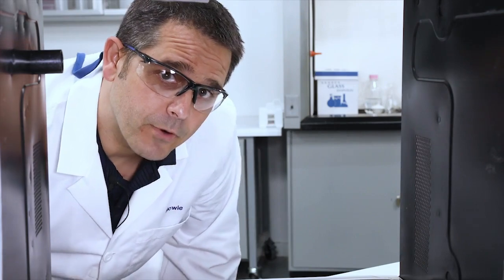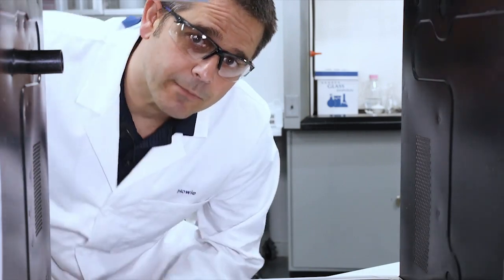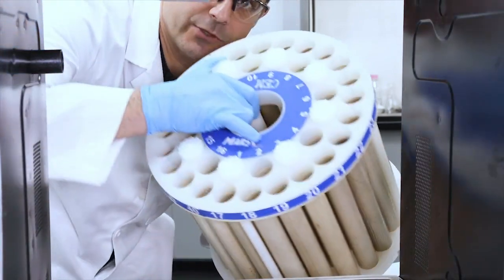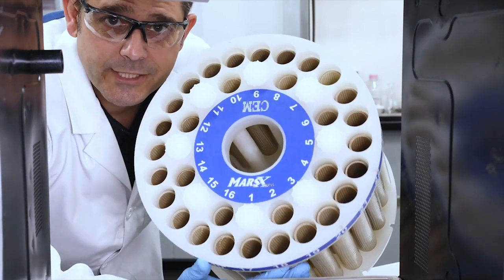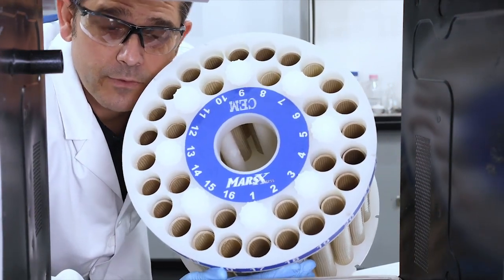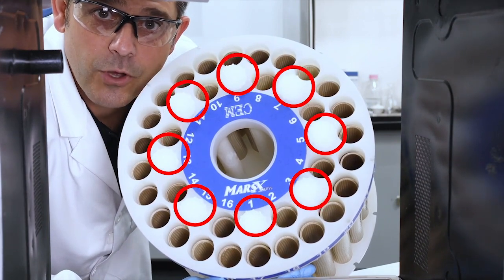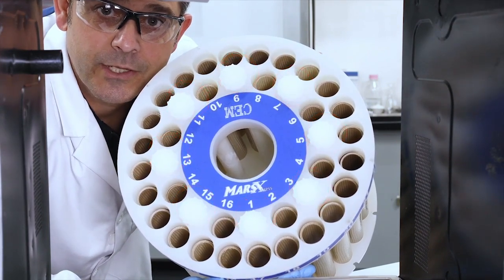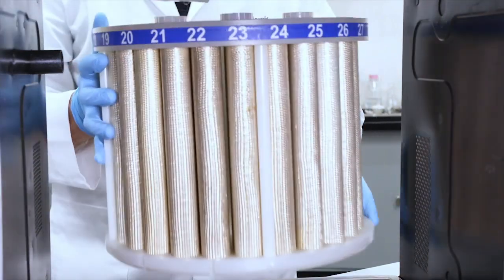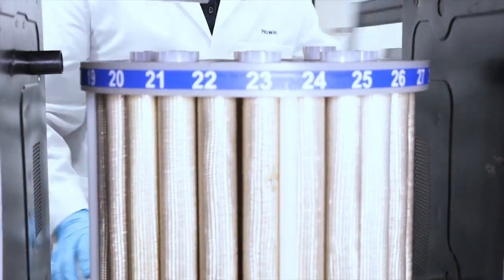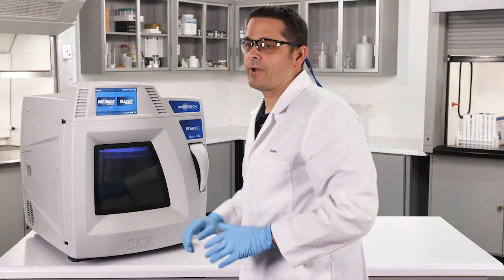Hey guys, one more tip for you before we get started. Remember I'm using a 40 position turntable but I'm only using eight vessels. So for best practice we want to spread the vessels evenly. I have eight, I'm using the inner row in every other position. This will be a great place to start.